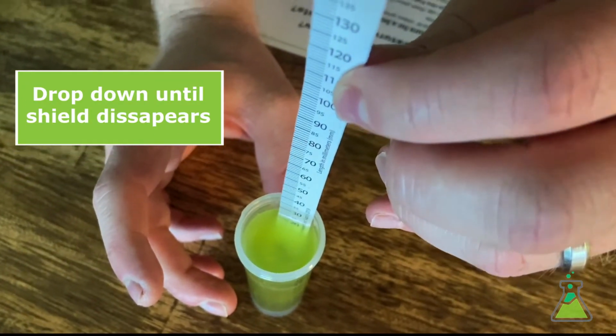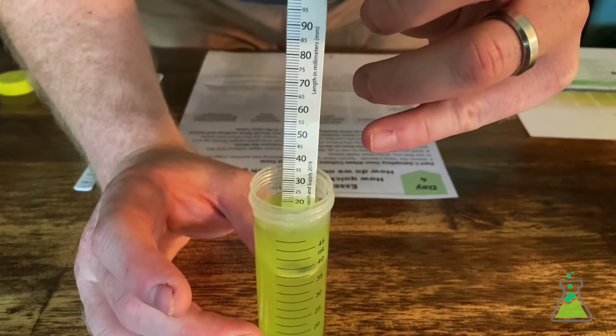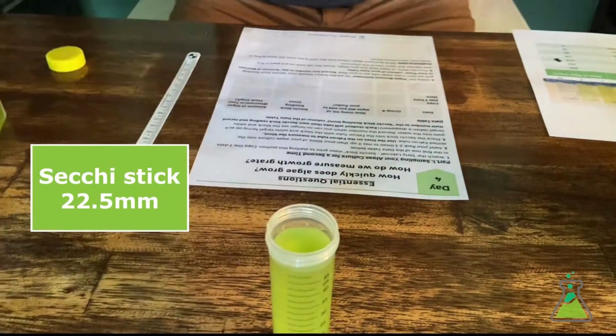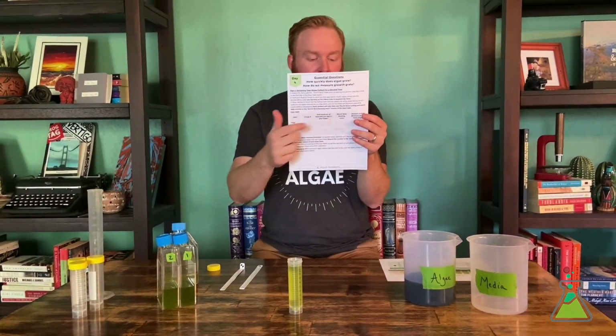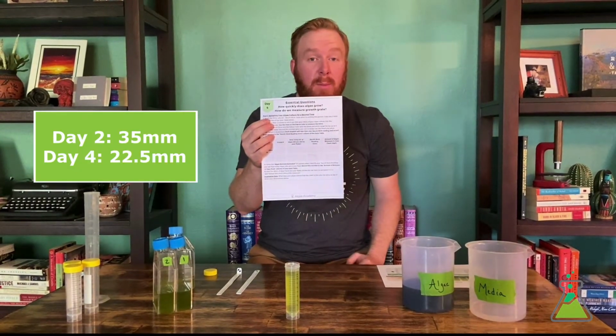It's disappearing right about there for me, which appears to be between 20 and 25 millimeters. So probably about 22.5 millimeters. So go ahead and mark that down here in the Secchi stick reading on the second line here. It will be 22.5 millimeters.